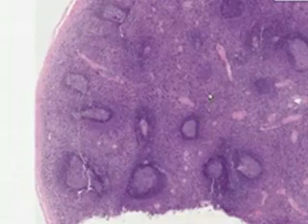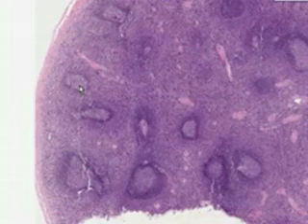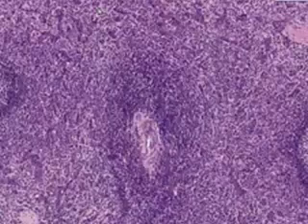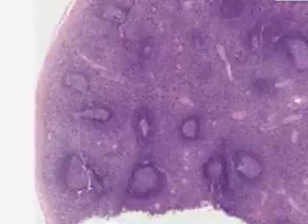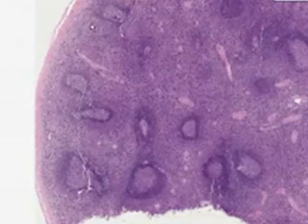But let's say that you cut through this organ grossly. So forget about the microscopic staining for now. These lymphoid areas would look white because lymphoid tissue, like in a lymph node, looks white. And the areas between the lymphoid follicles, because they appear to be rich in venous sinuses, would appear red. So that is how the name red pulp and white pulp got its name when you look at the spleen. And this is a spleen.